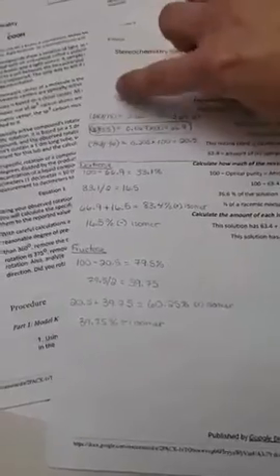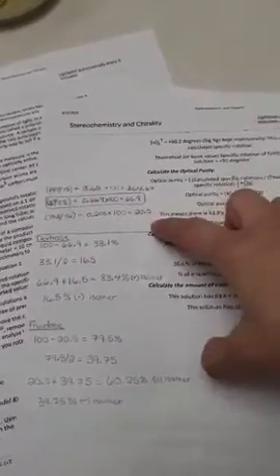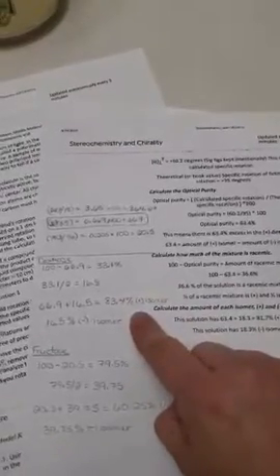If you see over here, I took the 54 from the front, which gave me a way bigger number, 364.67. So I did dextrose and fructose. They were my main two because they fit into the calculations. And I came out with dextrose having a 33.1% racemic mixture, and then it has 83.4 of the positive isomer and 16.5 of the negative isomer for the dextrose. So that's how I found my calculations.